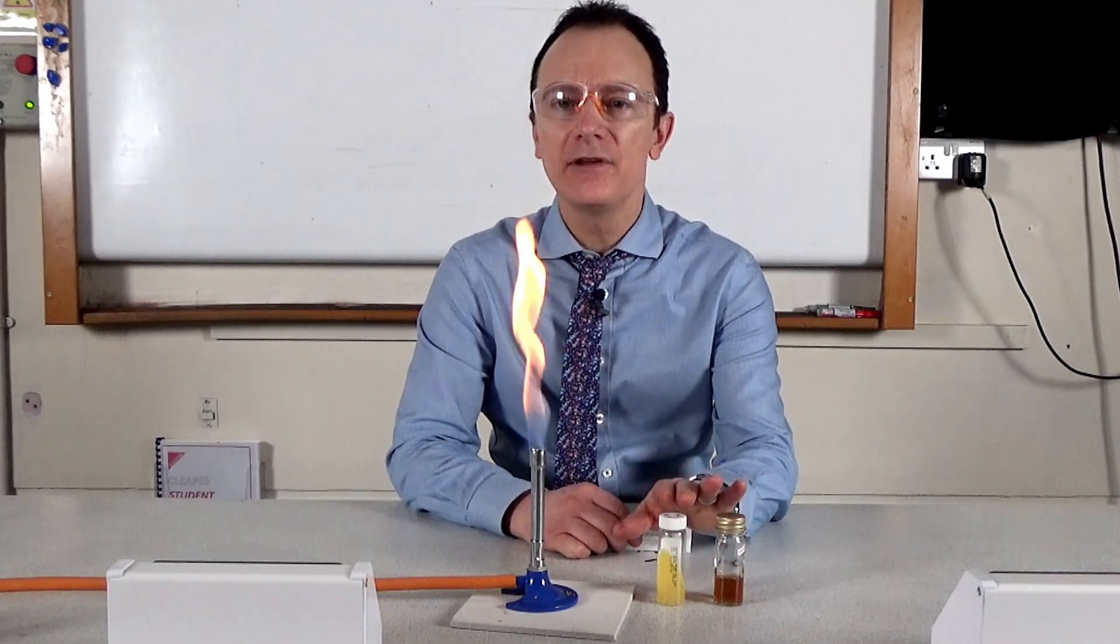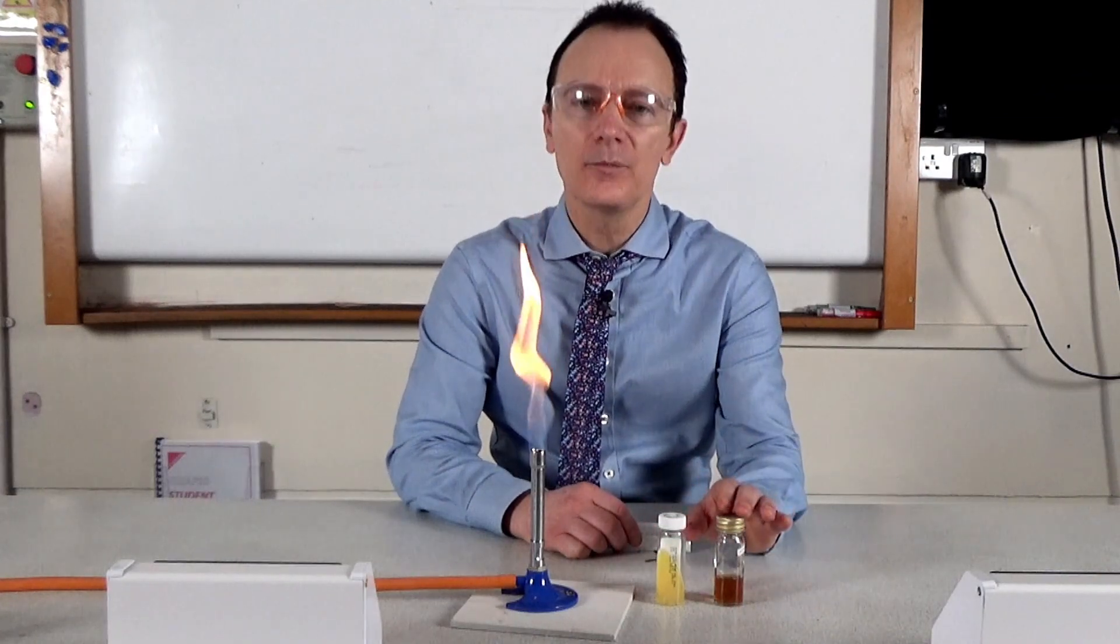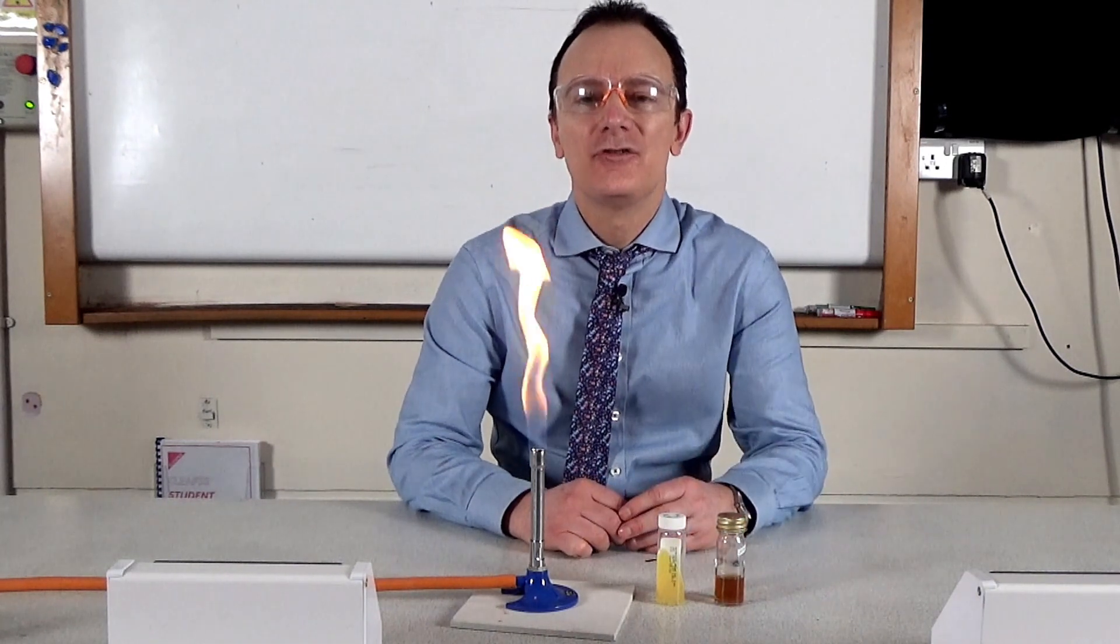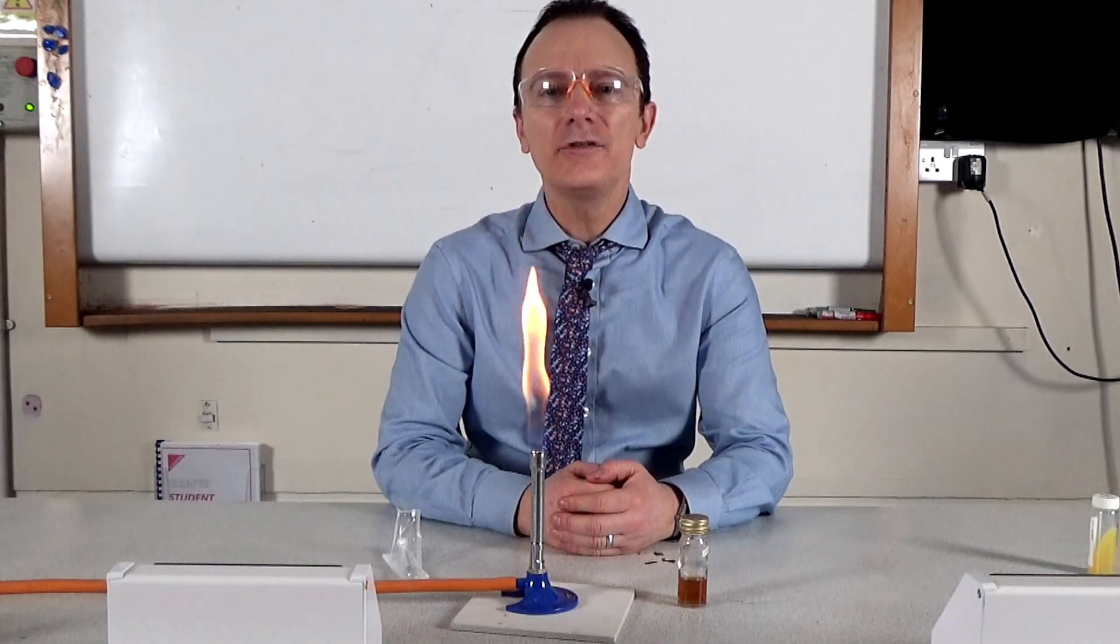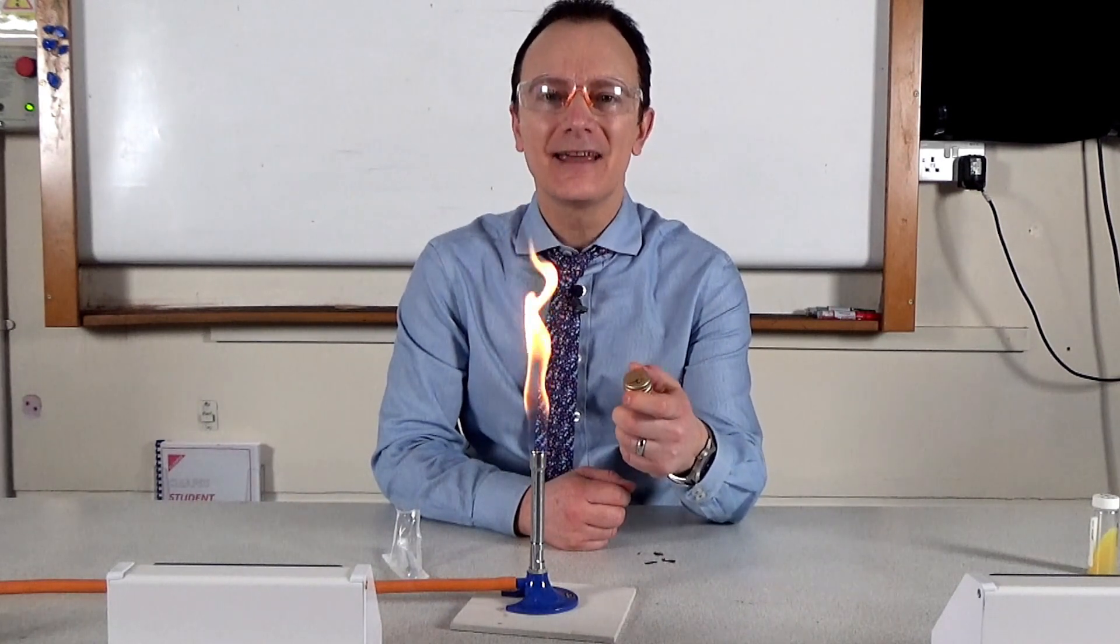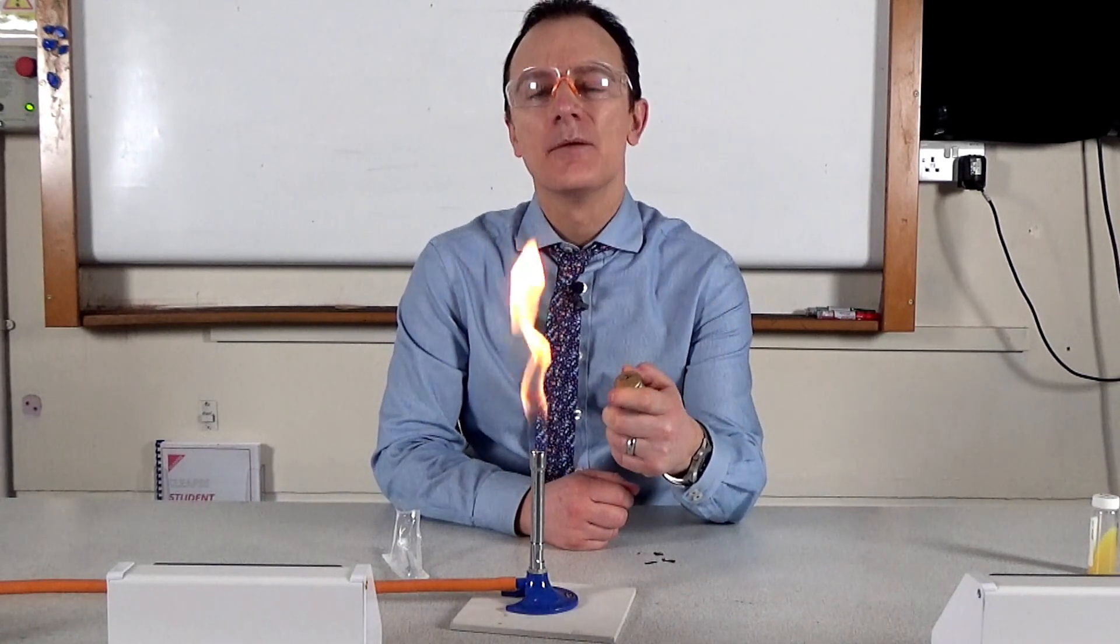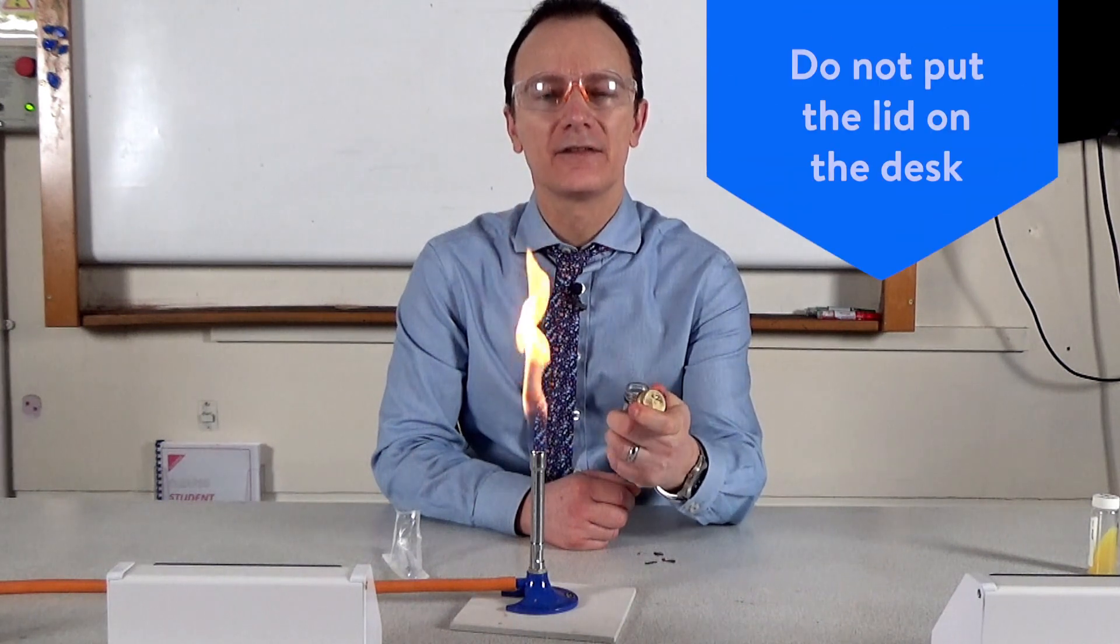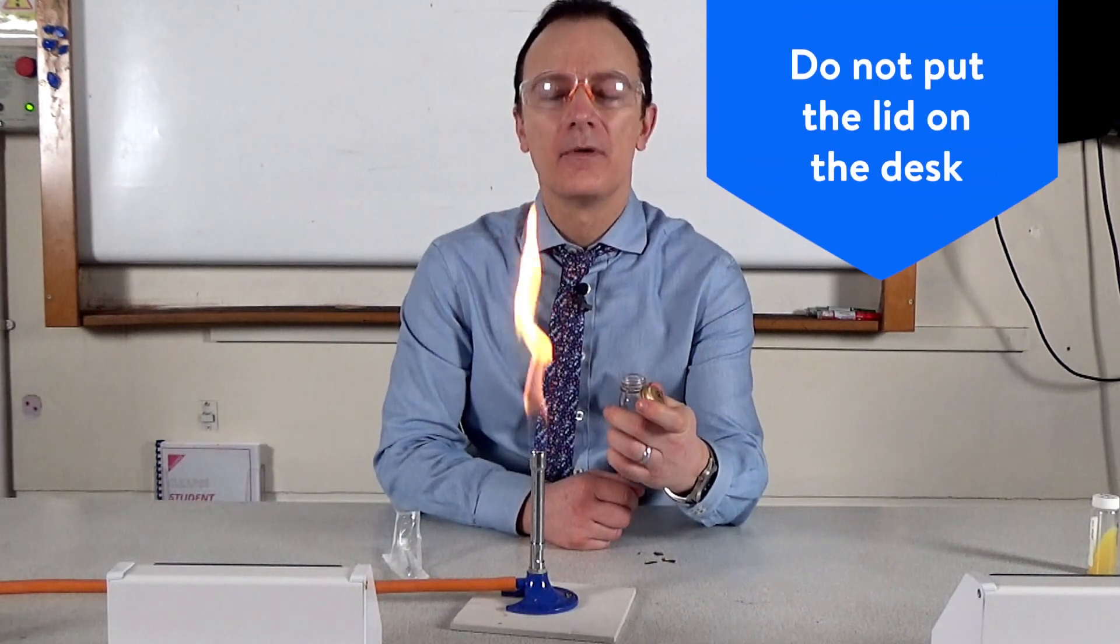What I've done here is use the original culture to produce a subculture by growing it in a nutrient broth. So using the subculture, your students hold the bottle in one hand and take the lid off with the same hand, but it's really important they don't put the lid on the desk where it could pick up some bacteria.